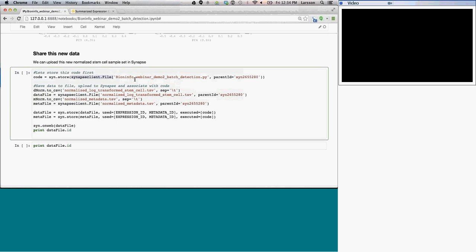So this file is called bioinfo webinar demo 2 batch detection py. You can see that up here. And I'm storing it inside a folder. This is the ID of the folder. And then I'm also going to save the normalized form of the log transform stem cell data. This is the one that we just generated. And I'm going to store that again on Synapse. I'm going to also store the normalized data set.